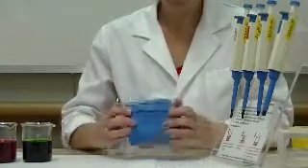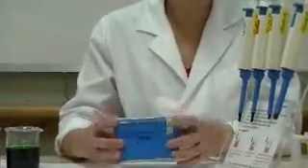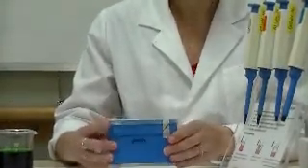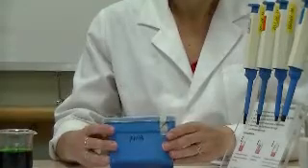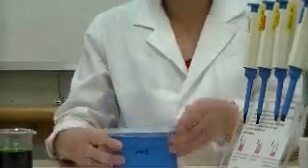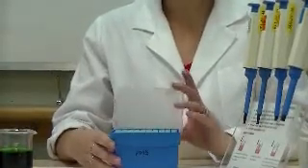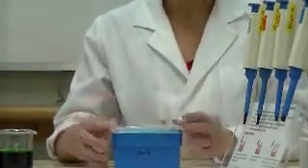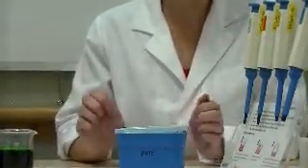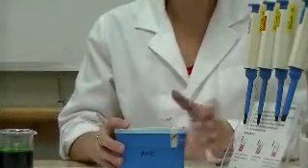You will notice that your tip boxes often have a piece of masking tape with stripes across. When that is unbroken, that means that the tips are sterile. So when you are using the tips, make sure that you open and close the lid quickly after having selected a tip. And if your tips spill onto the bench, and it's important for you to have sterile tips, then you should ask a demonstrator for a new box.